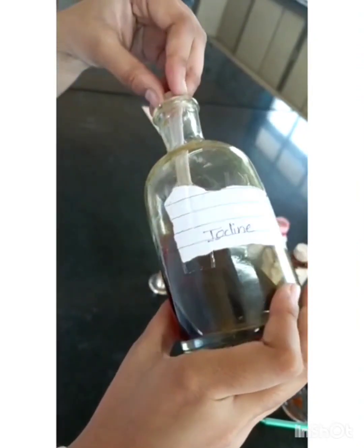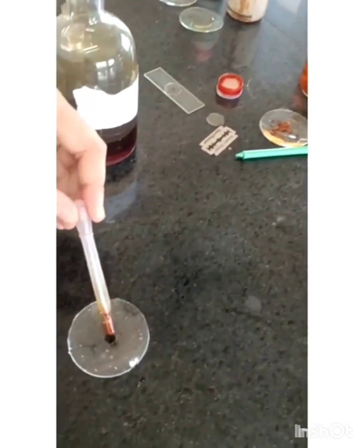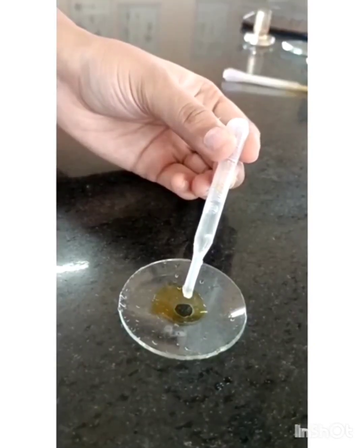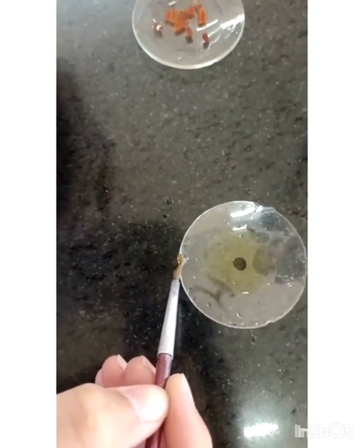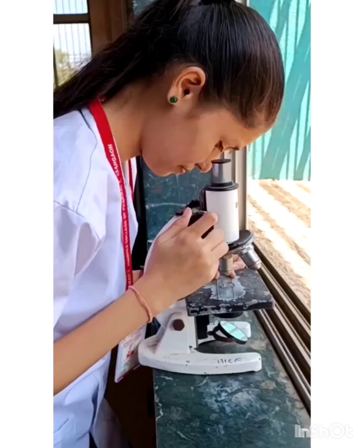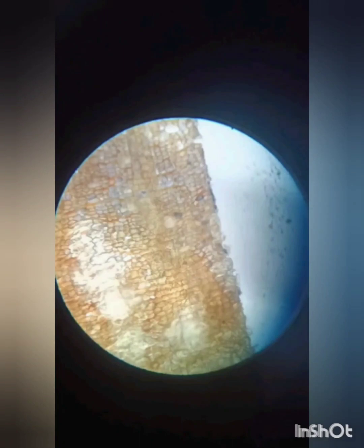Take iodine solution and dilute it with water for staining purpose. Take a thin section from your watch glass and mix it with the staining reagent. Then place the section on the slide and put the cover slip over it. Observe it under the microscope.